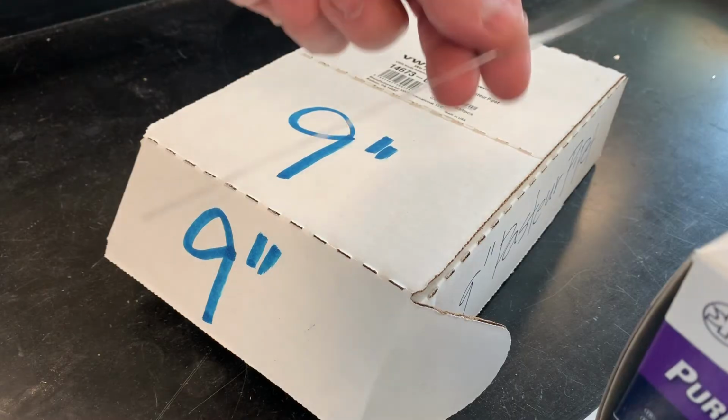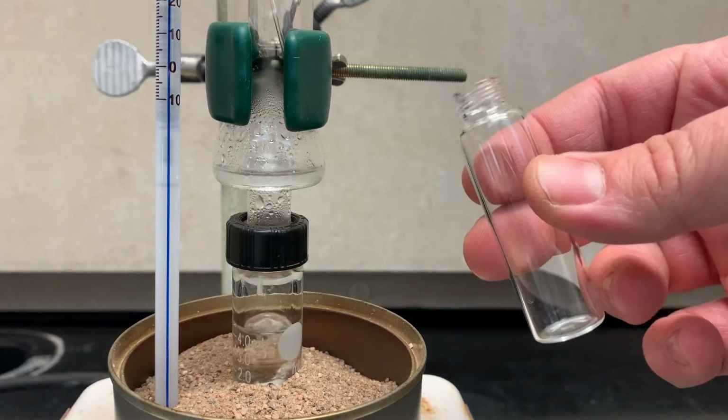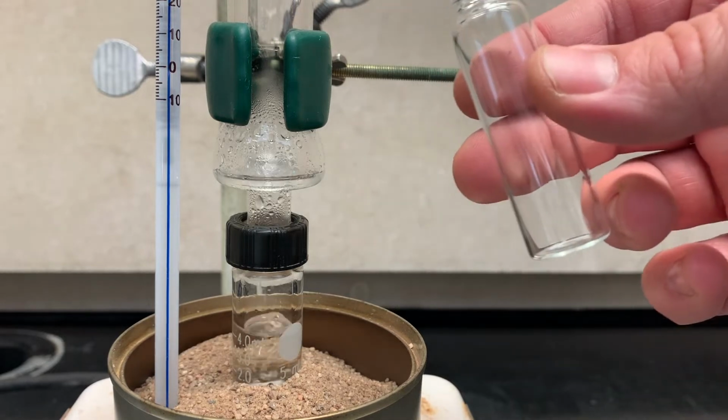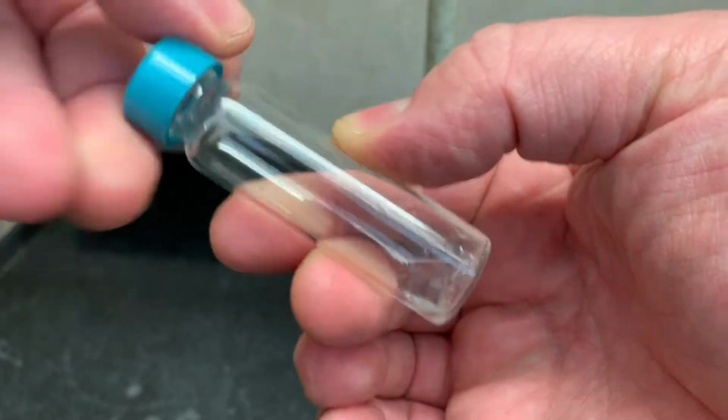And you'll need a 9-inch pipette. They'll be out on the bench top somewhere. Bring your vial close just in case it drips so you don't lose anything. Slip your pipette in at a sideways angle and collect some of your sample. Now you're not going to get everything at once, so make sure you cap your vial between recoveries.